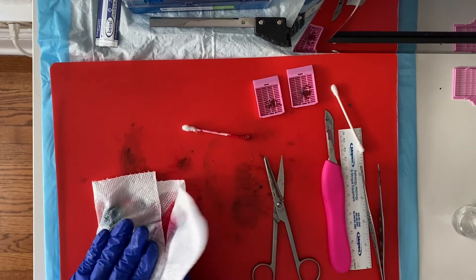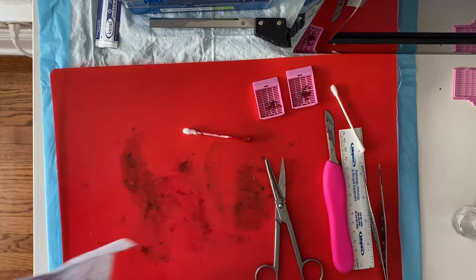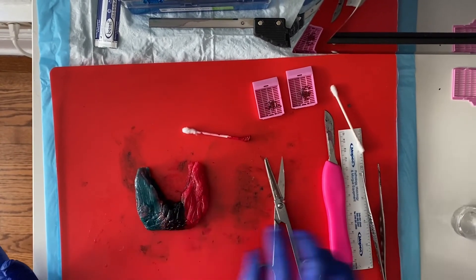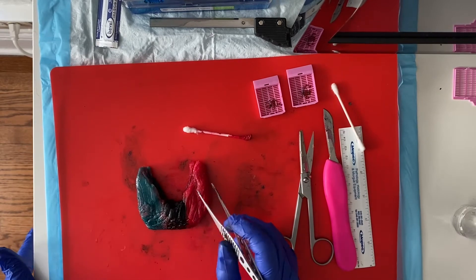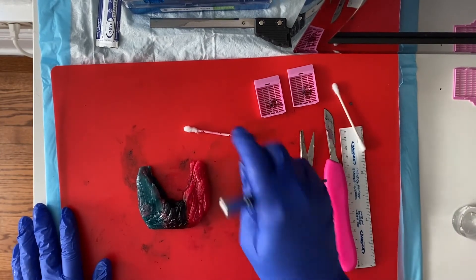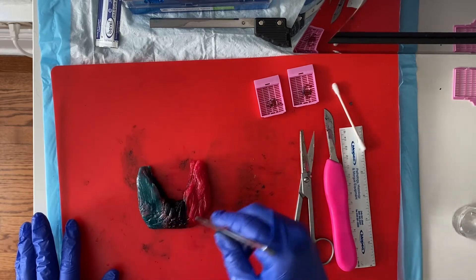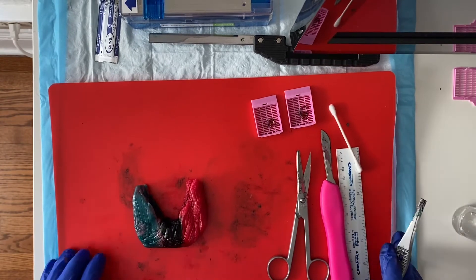Right now posterior is facing up: red on the right side, green on the left side, black on our isthmus. Normally what we would do is take a fourth ink color and overlay the posterior surface on top of these colors, so that when I slice through, I'll know with each slice what's anterior and what's posterior. Since I only have three colors at my home dissection bench, I'll be careful when laying out my slices. But those of you at home, overlay a fourth color onto your posterior aspect to maintain the orientation of your slices.